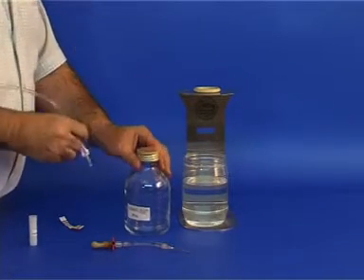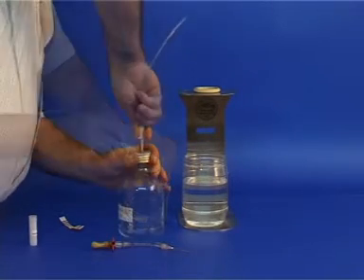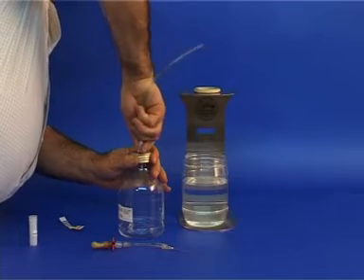Take the spike assembly, close its valve, and place the rubber stopper all the way through one of the depressions.